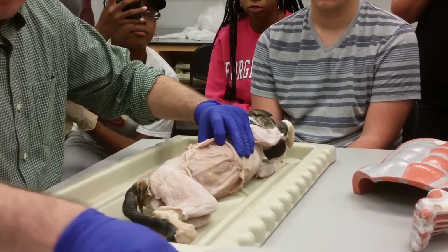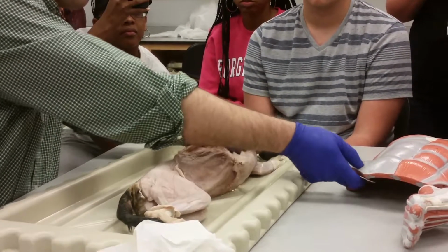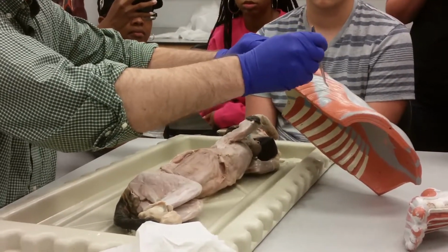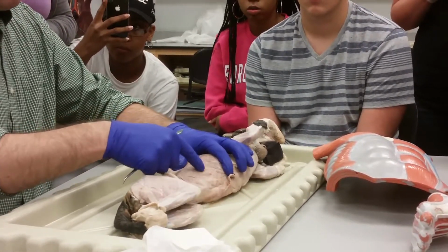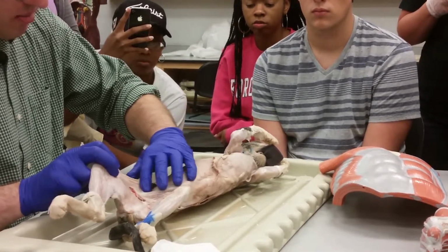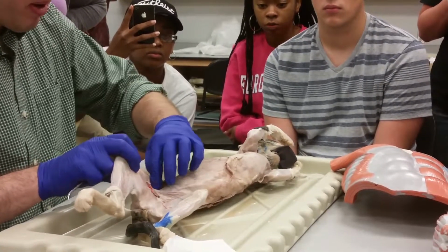You can kind of see where it ends right there, sort of in a cup shape, right? Sort of like here on this model, where it ends in the ribs like that. And then it goes down at this angle, and if I spread it out, you can see the fibers going down like this, headed down towards the pelvis. I tore its aponeurosis a little bit right there, so pretend that hole's not there.